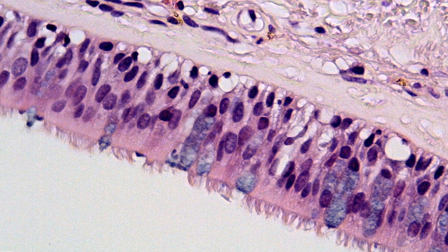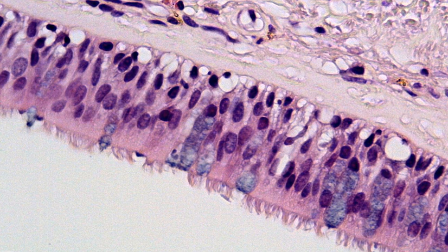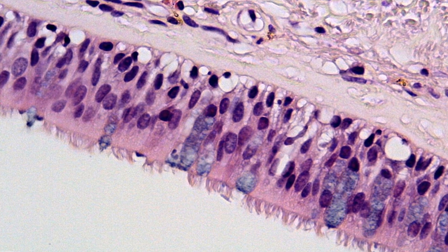If you go just a little bit deeper in the tissue, you can see these purple kind of oval shapes. Here's another one. All of these purple oval shapes are the goblet cells. Now these goblet cells are able to produce mucin. Now this mucin, or this mucus, will be secreted and it can help to trap debris and trap small particles on the apical surface. Once it traps particles, the cilia will beat in their wave-like fashion to remove the actual mucus and propel it out of the trachea.